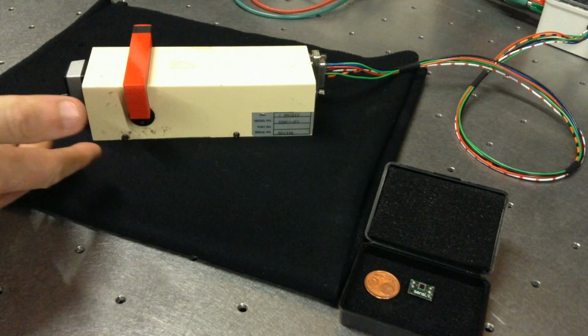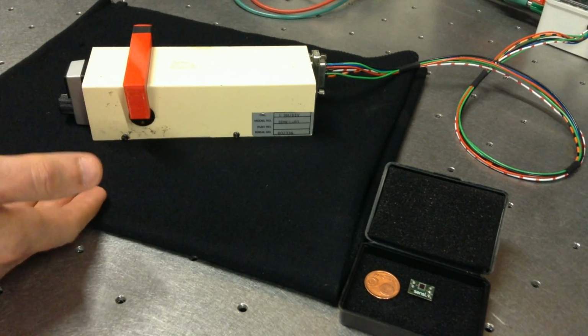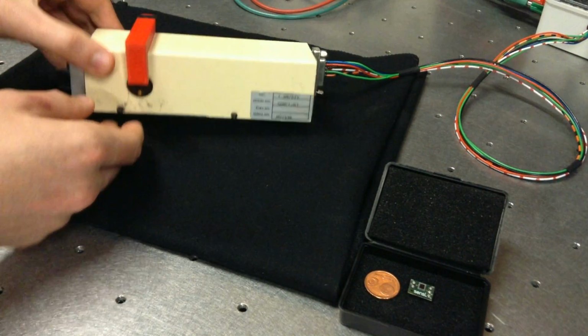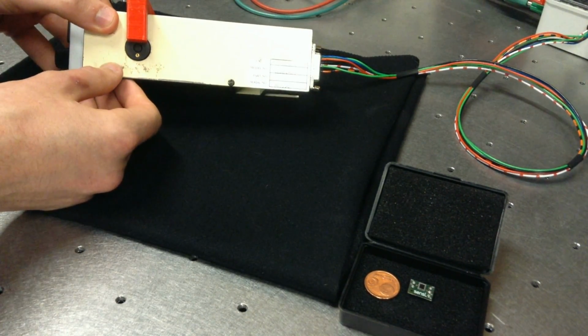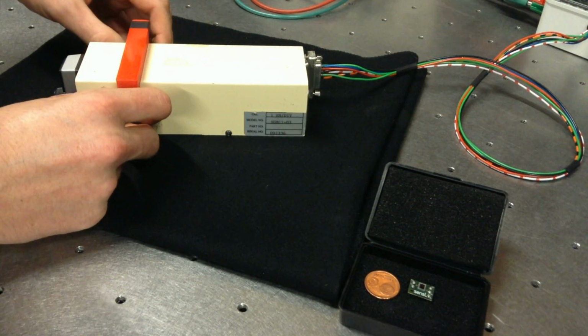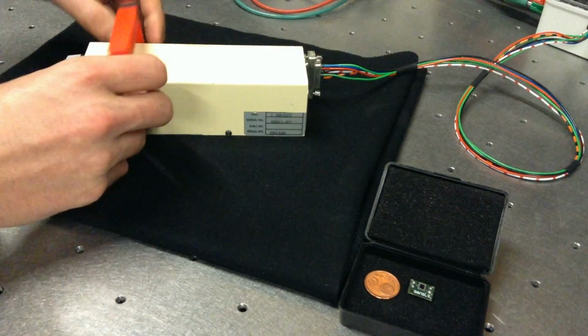So this is the Ealing Optics Scanning Digital Mini Monochromator. It has an operational range of 300 to 800 nanometers. The slit width on the entrance and exit is a 100 micrometer slit. On the exit slit is mounted the SiPM, which has its own 3D printed mount.